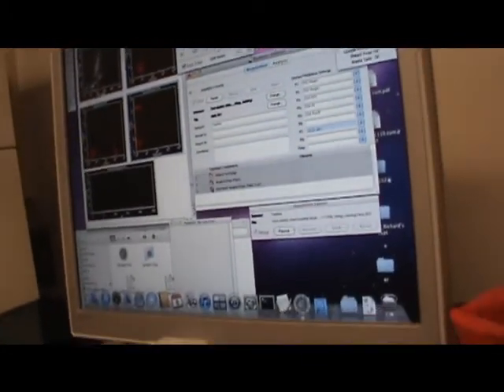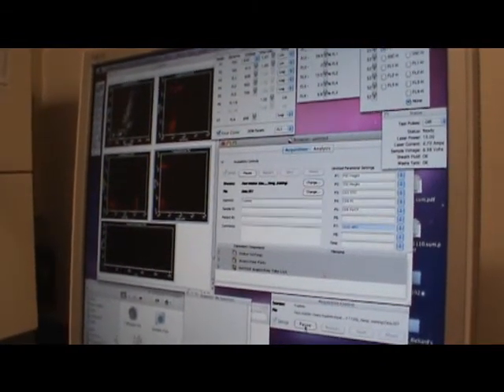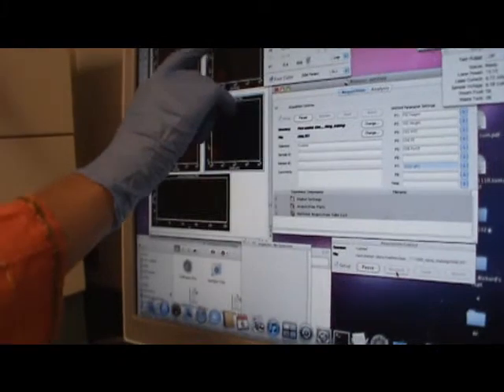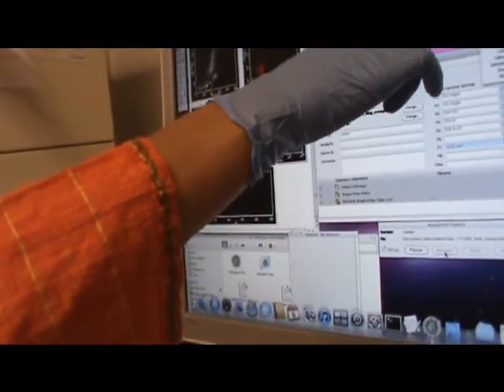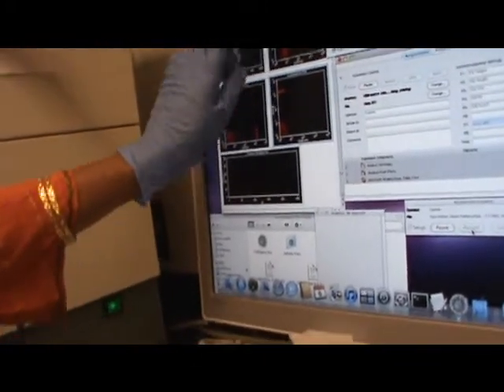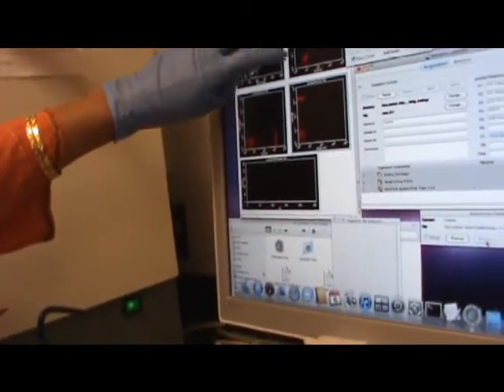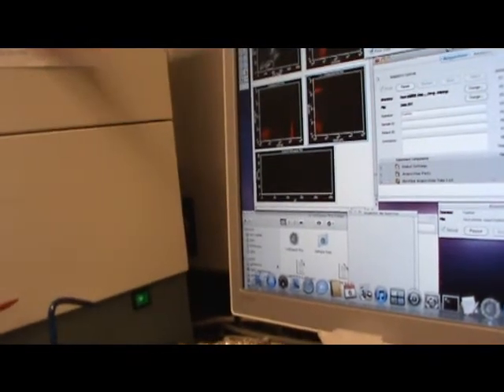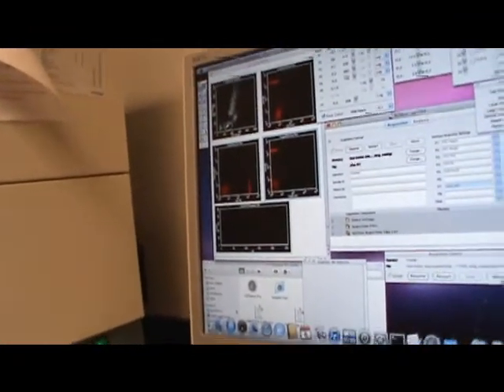Yes. And then you see here, you keep watching here, I'm doing FL1 minus FL2. Look at the population. Now the population is fine. Because this was being detected here, and that's a very big problem because that's PE positive. It should not be in the FITC channel. So I compensated it using these numbers to get it right. If this is your FITC positive, and PE positive, but instead of being here, if it is here, there could be a problem. So you will say pause, abort.